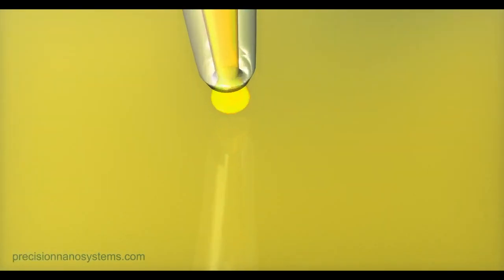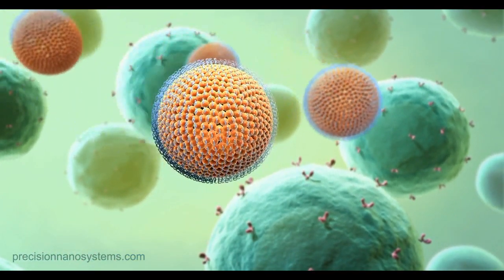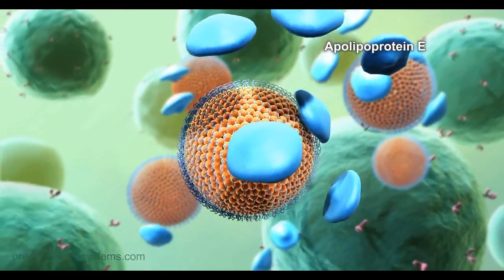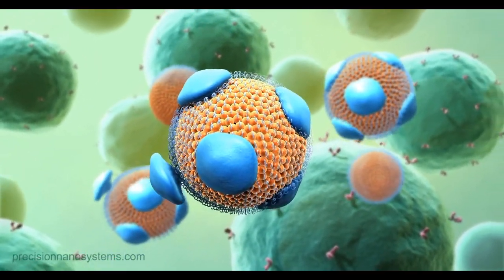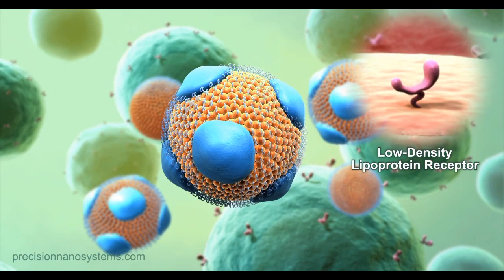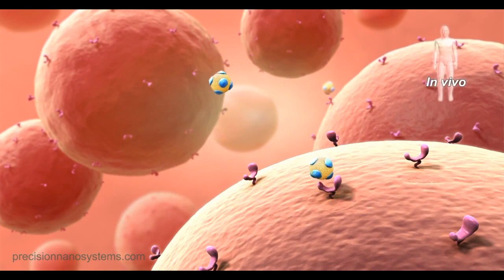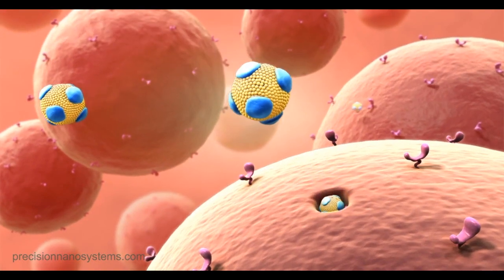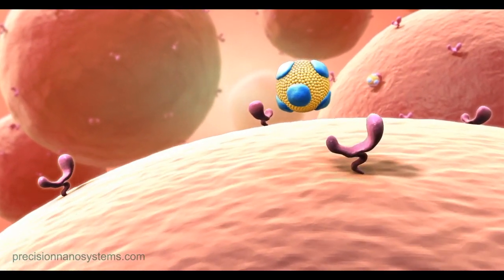Nanoparticles are applied to cells in culture. Apolipoprotein E, or ApoE, adsorbs onto the surface of the lipid nanoparticle. ApoE is a ligand for the LDL receptor. As LDL receptors are ubiquitously expressed on primary cells, this mechanism can be exploited to promote nanoparticle uptake in a wide variety of cells.